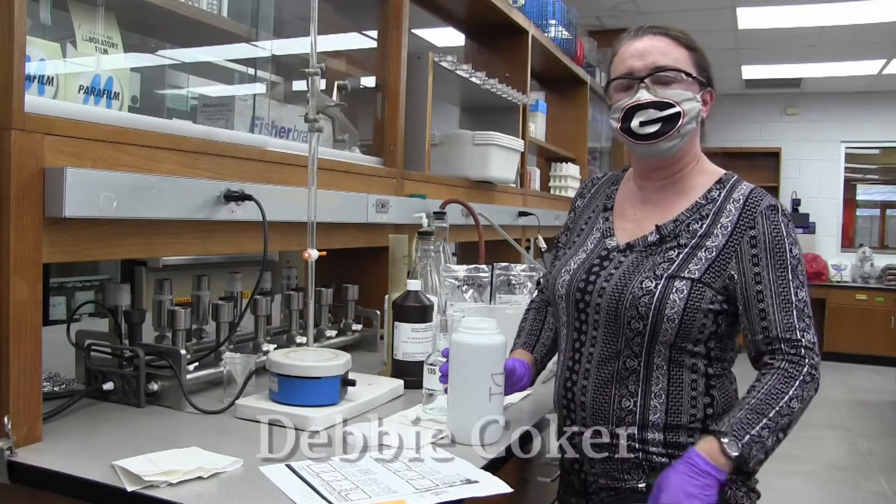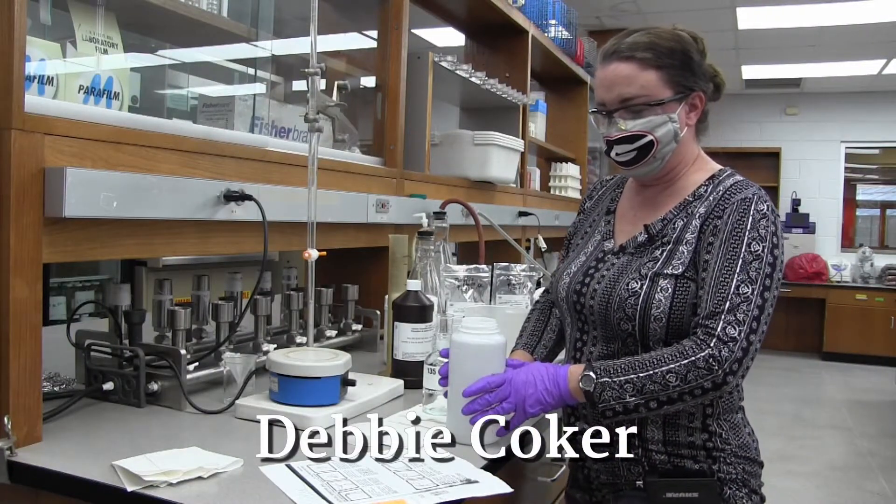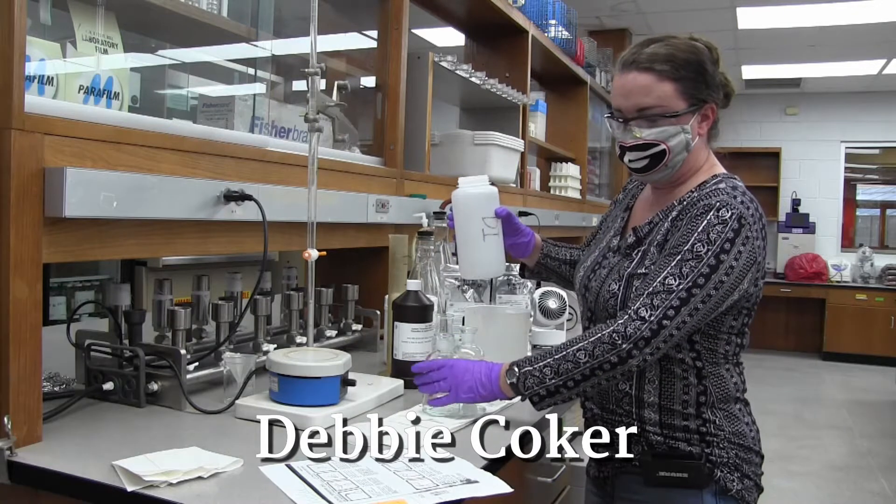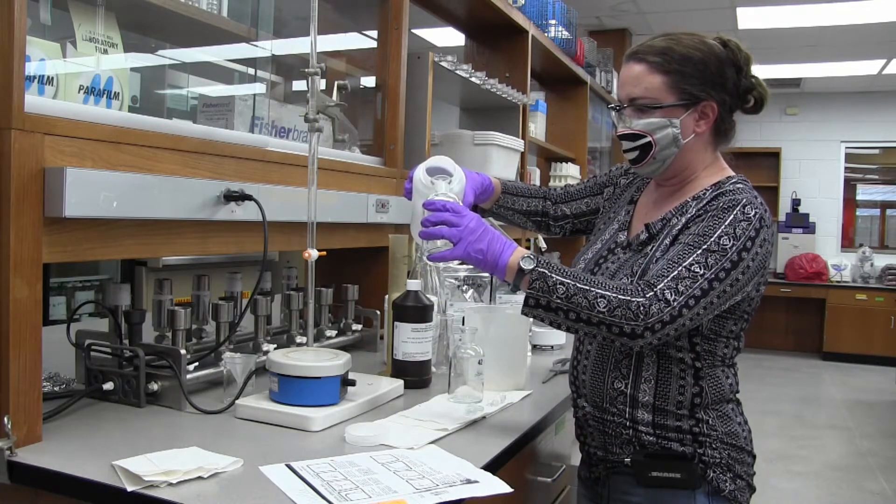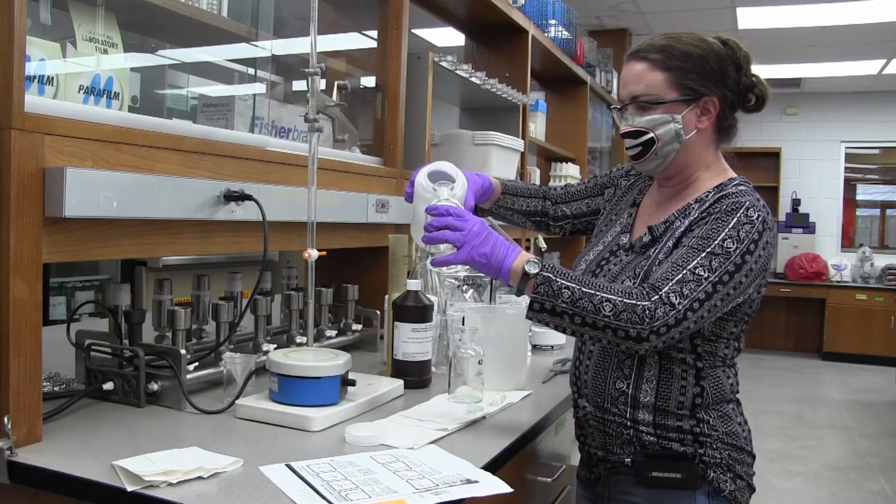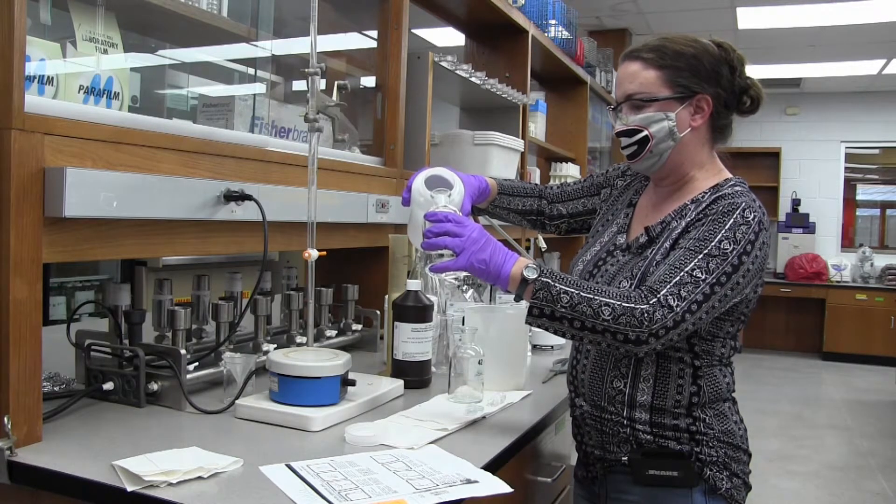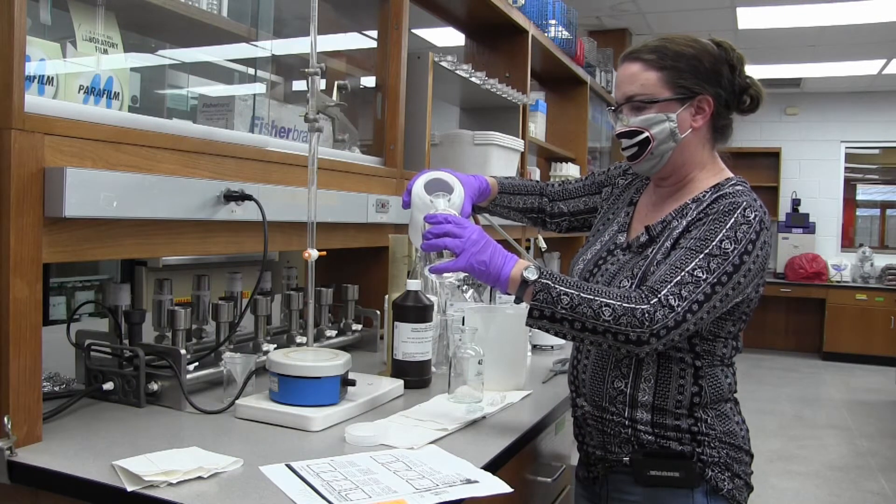We're going to do the Winkler method today. First we're going to take a water sample and pour it into some BOD bottles. I try to pour it down the side so we won't introduce any new air bubbles.